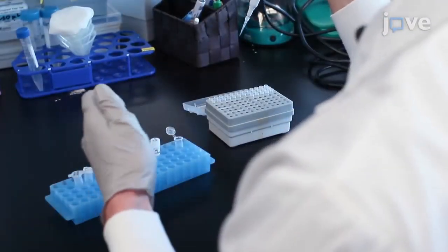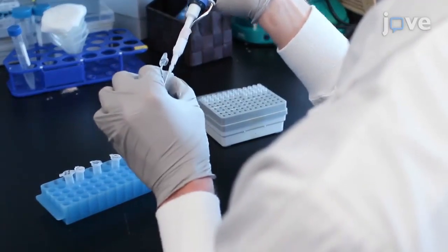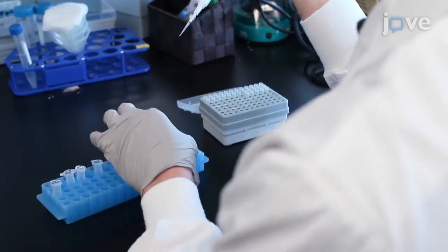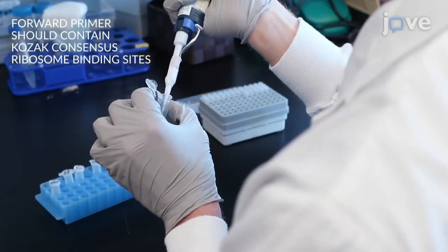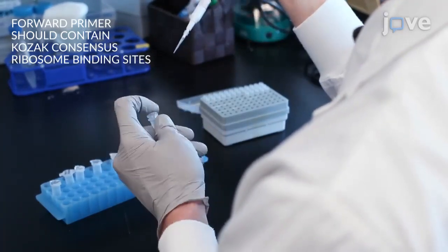Using high fidelity TAQ polymerase and standard overlap PCR techniques, flank the gene of interest with two selected restriction enzyme recognition sites using designer primers.